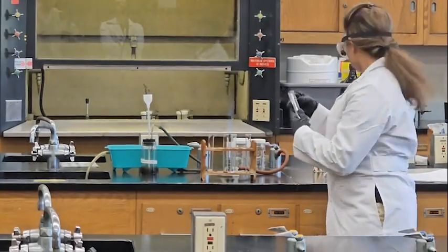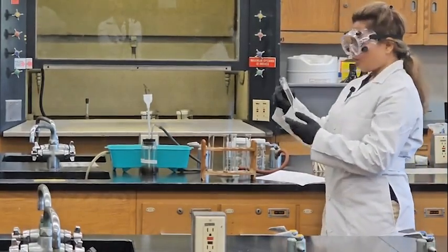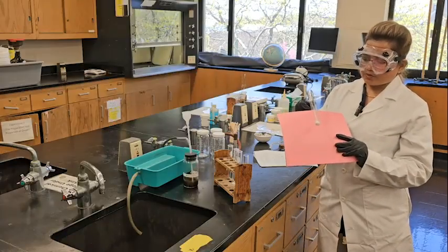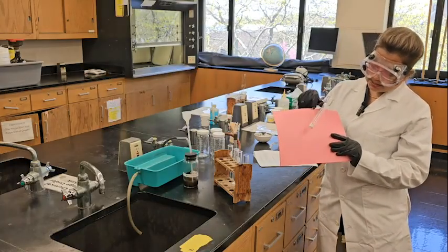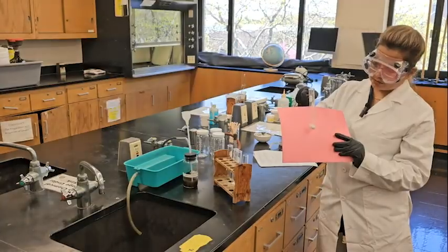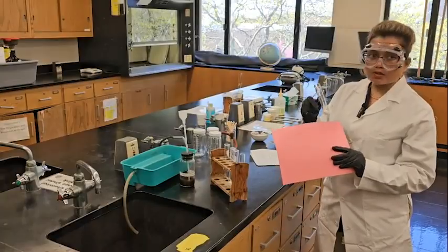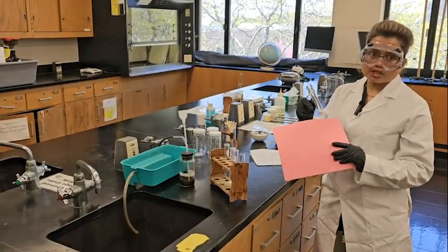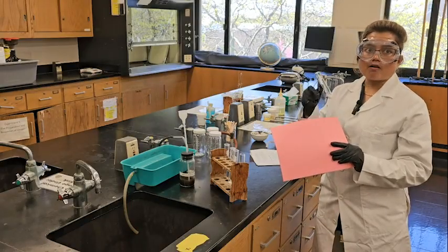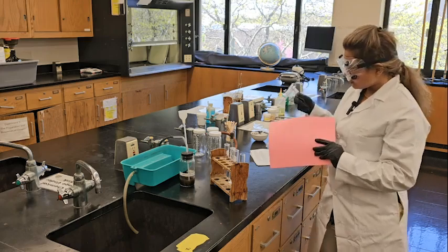Okay, so first we are using sodium nitrate, which is white and solid. So guys, this is sodium nitrate, right? And as you can see, this is solid and white color, right? So now I'm going to heat it up, and I want to check whether the physical properties change or not. Physical properties means whether the color changes or the state of matter changes or not. Okay, so let's see.